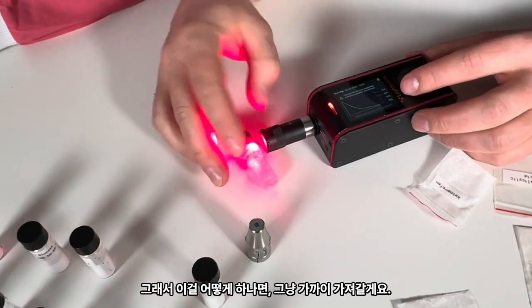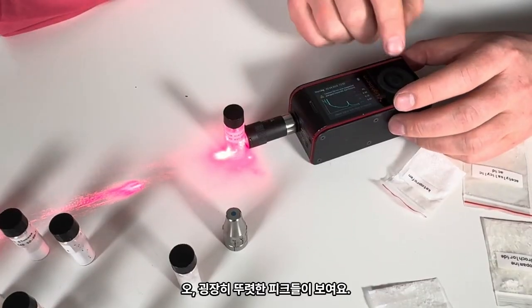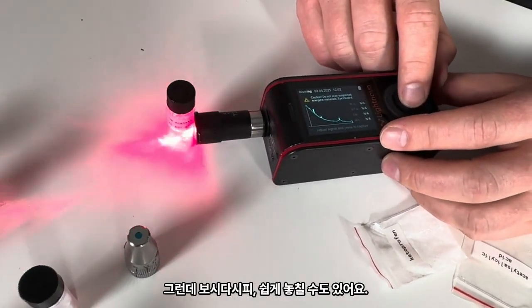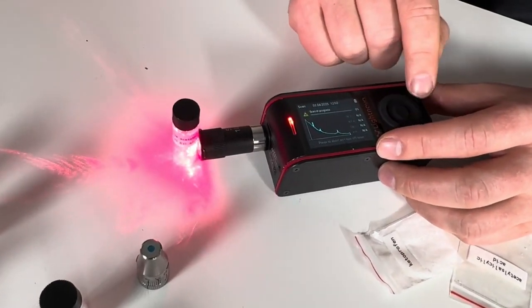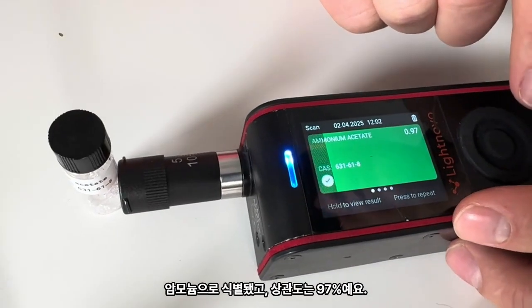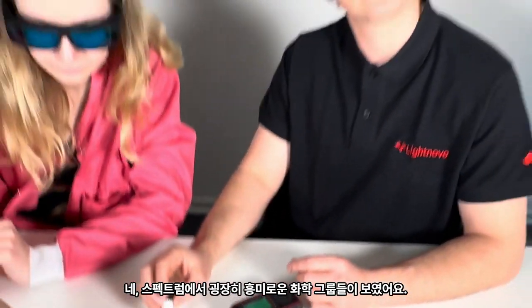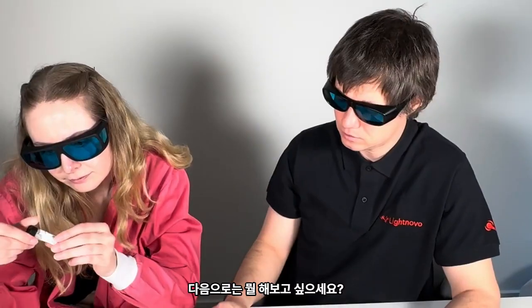So how do we do it? I will just get closer to it. Oh, very defined peaks. But you see, I can easily miss them. Let's press. Ammonium acetate, 97% correlation. But it's very interesting chemical groups we saw in the spectrum. What else would we try?